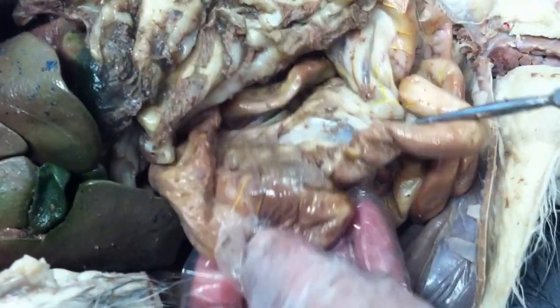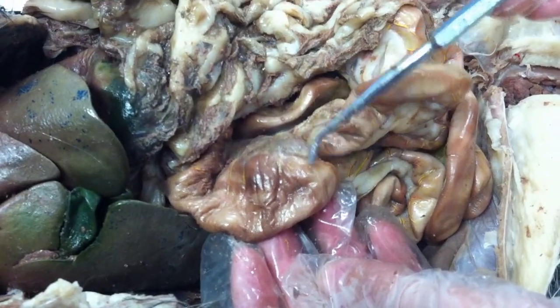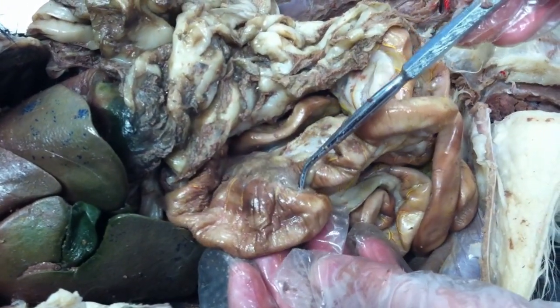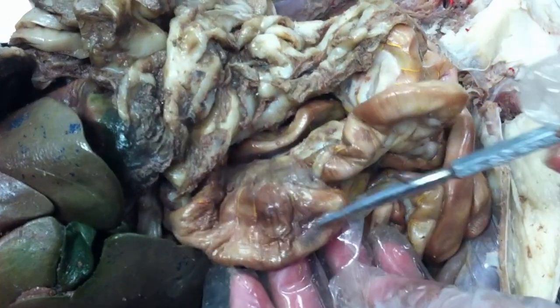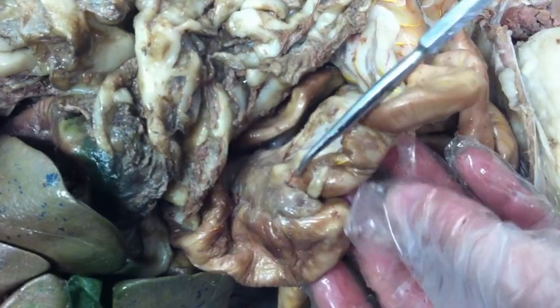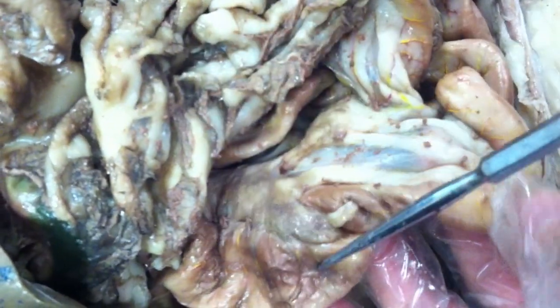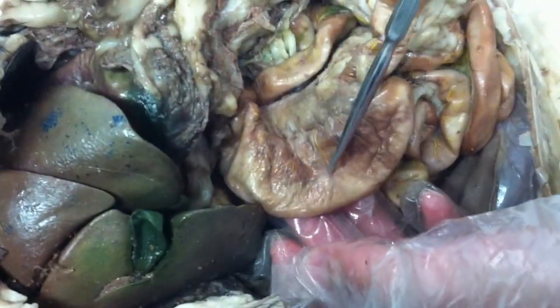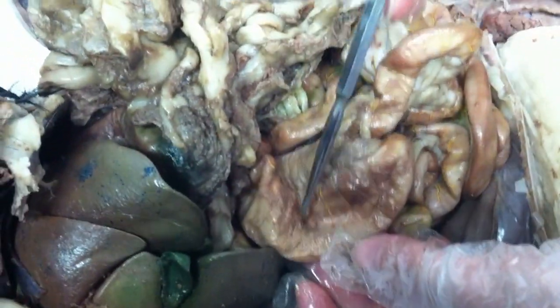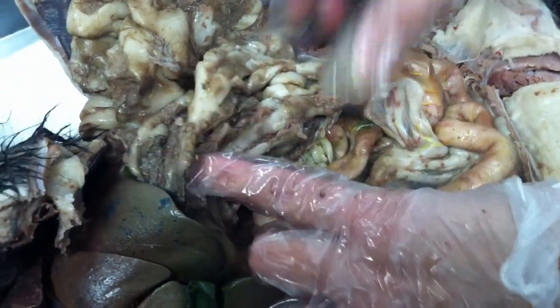That's the ileum? Yes. You see the difference in size, right? The small intestine and the large intestine, okay? And the first part of this large intestine is the cecum. Cecum. This part, right? So the ileum would be what? Ileum is the last part of the small intestine, right? And that's the cecum part, the starting part of the large intestine. That's right. So this cat has a short ascending colon, right? And then the transverse colon goes across the body.